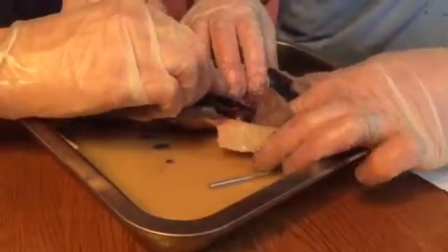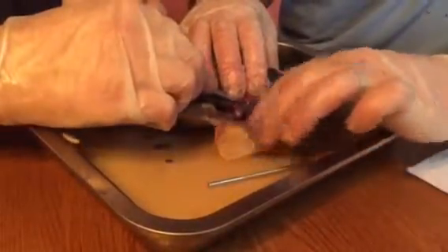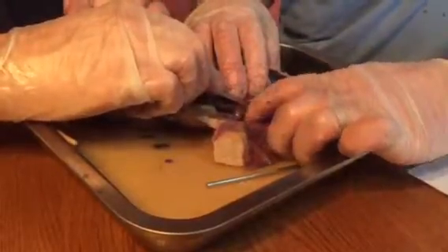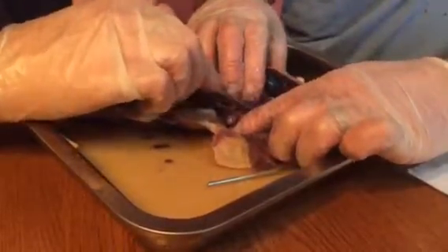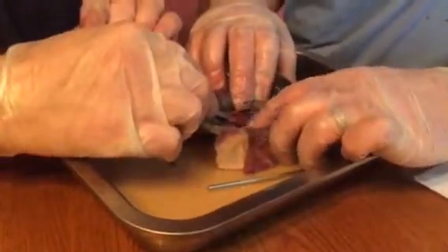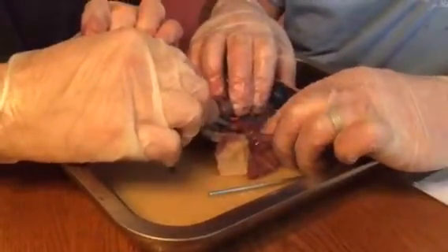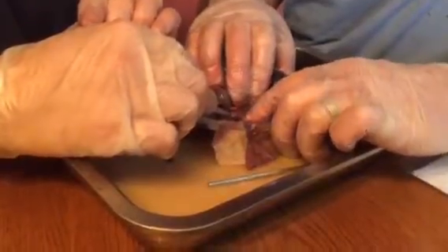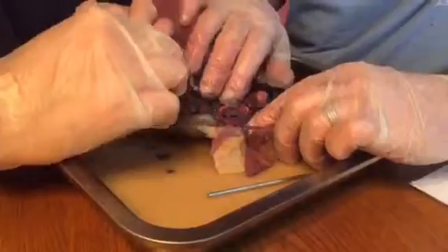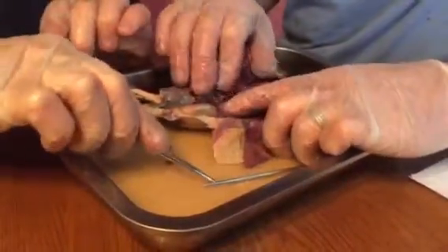Actually, it looks like a cyst right there, like a kidney cyst. That little dude right there. That's not normal. The kidneys, you can see why they call them beans. Yeah, definitely. And they go into the ureter. You're never going to see her bladder, though. Her bladder's tiny. It'll be right down.